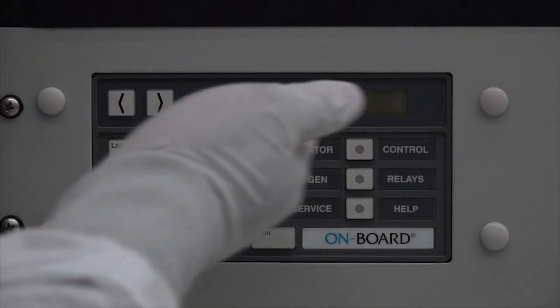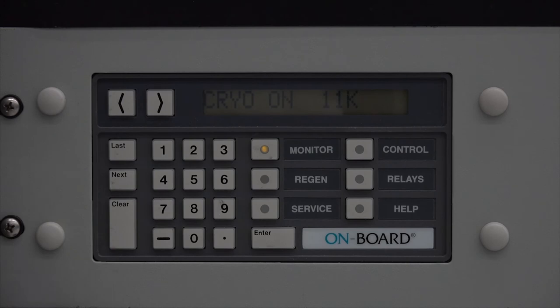Here is the cryopump controller, indicating the temperature of the cryopump. We can see that it is currently at 11 degrees Kelvin, that's negative 262 degrees Celsius, within the normal operating range.